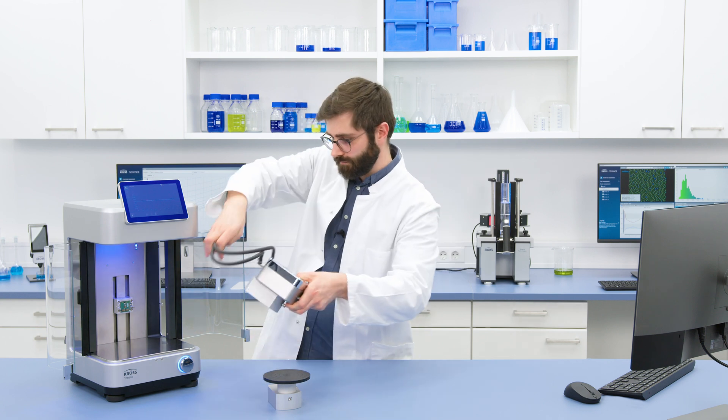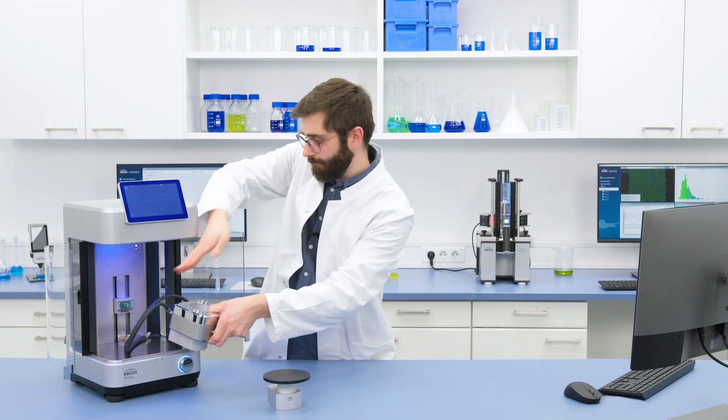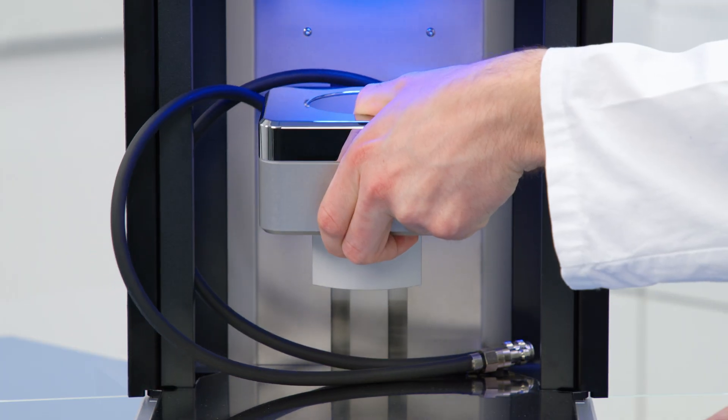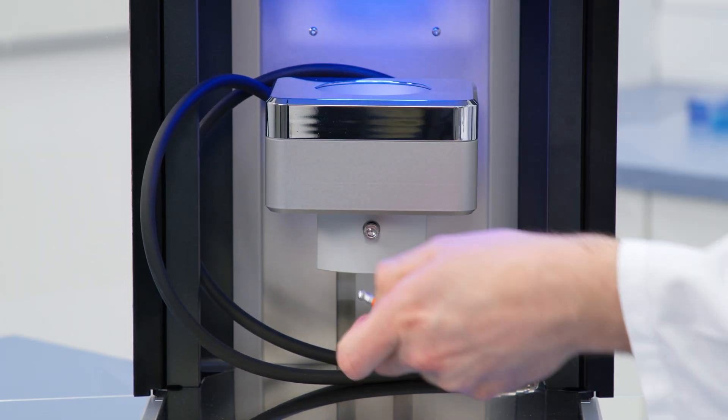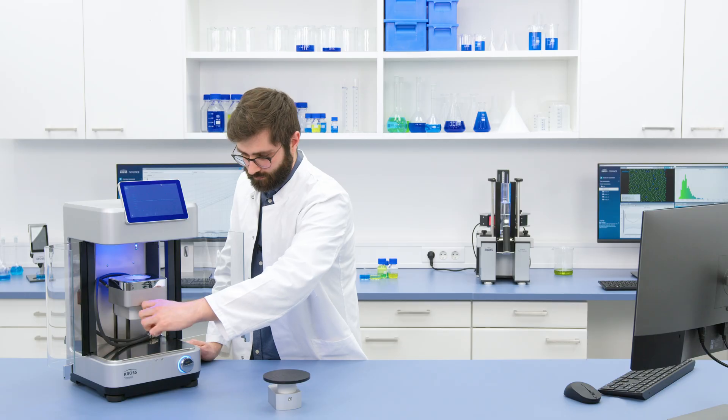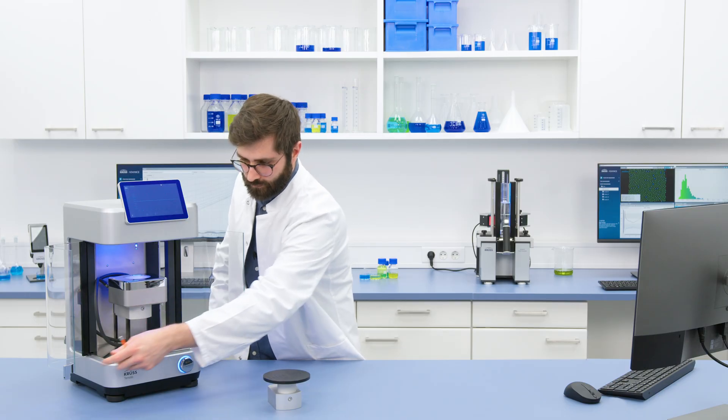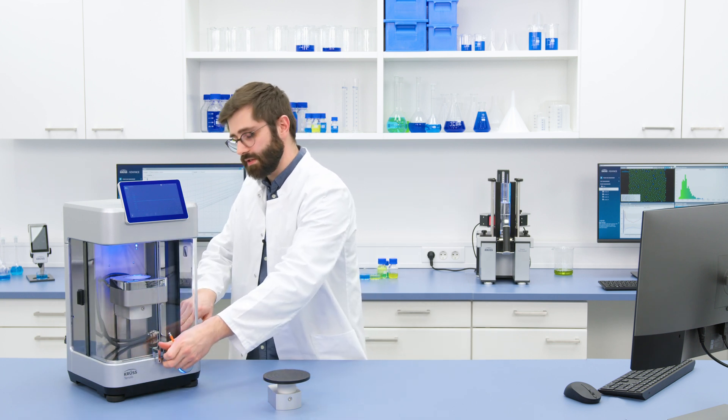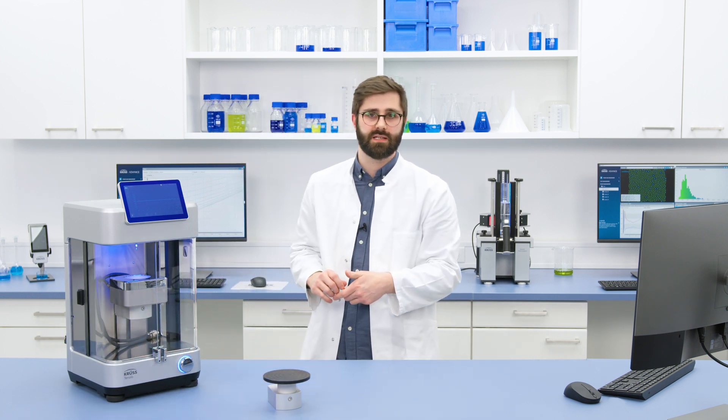And I can put in the Peltier, and now I could feed the tubing through one of these side panels if I needed to.